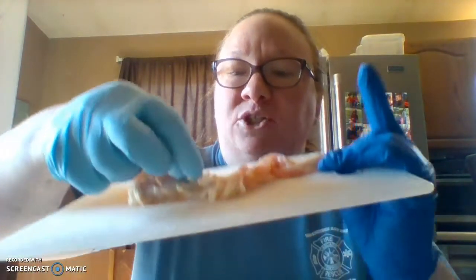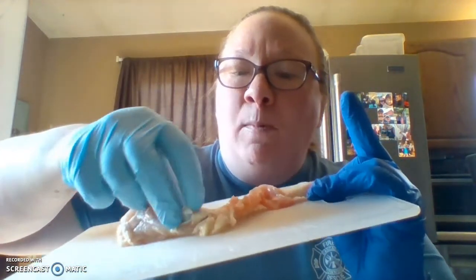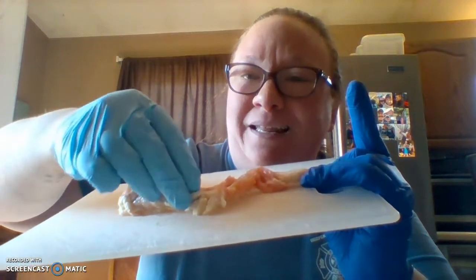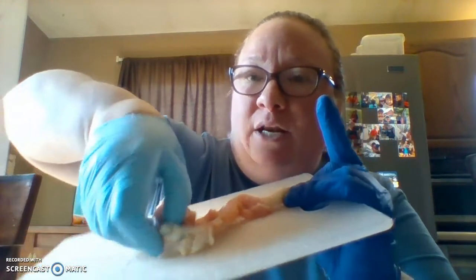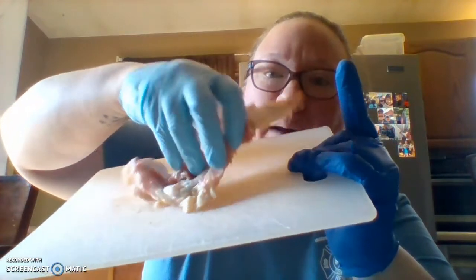The articular cartilage is going to be this tough white cartilage here. The synovial membrane is going to be the thinner membrane down in here that you can see, this thin membrane. The synovial fluid is in there. That's what allows our bones to slide past each other, that synovial fluid. The whole thing is the articular capsule here, and you can see as we move the capsule, we can move it.